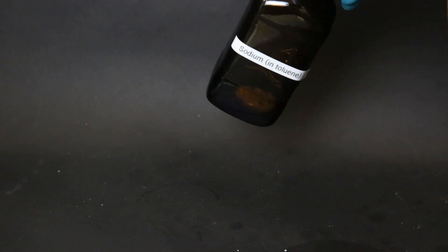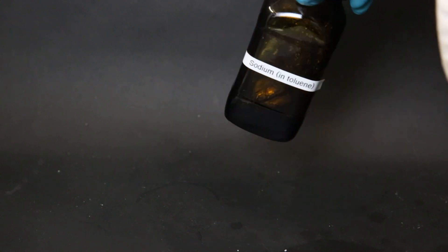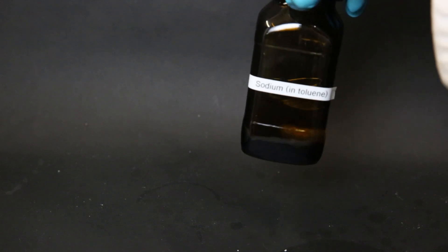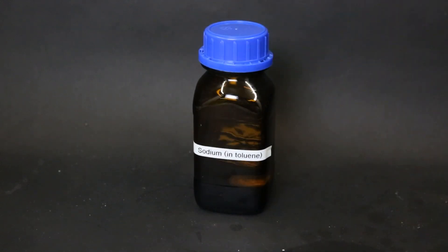Though my reaction did complete in under 15 hours which is a lot faster than the original protocol, which is likely because my magnesium was a lot finer. I don't know yet what I will use this sodium for but I might use it for drying solvents.